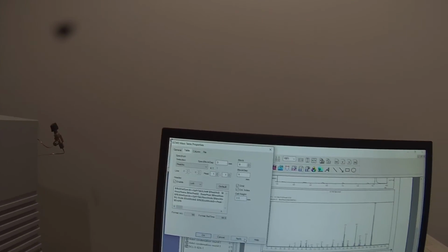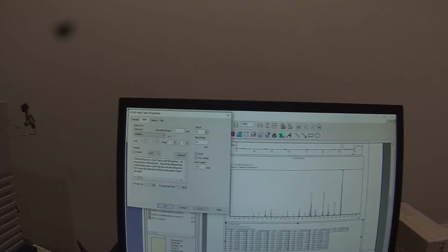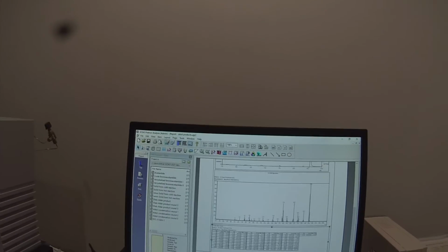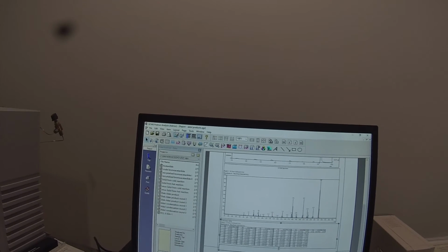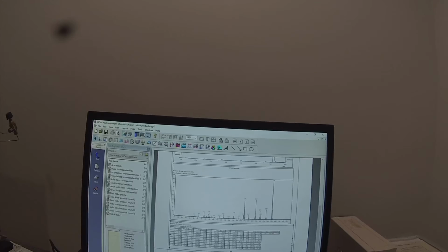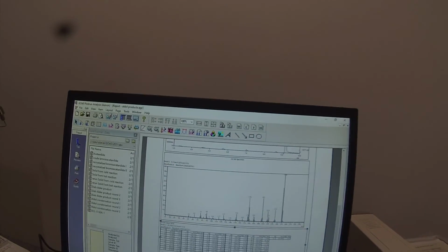Change that to 2.5 millimeters. Now it's getting me all the peaks. Well, that looks good. I can OK that. Now it's giving me 10 rows. And I'm getting all the way to this peak of 252.